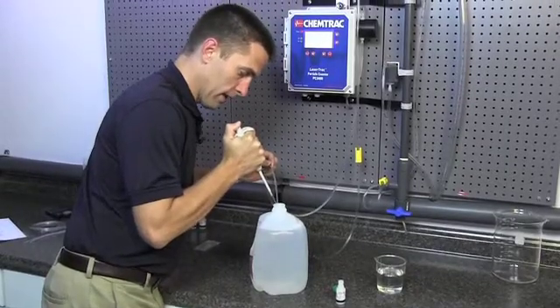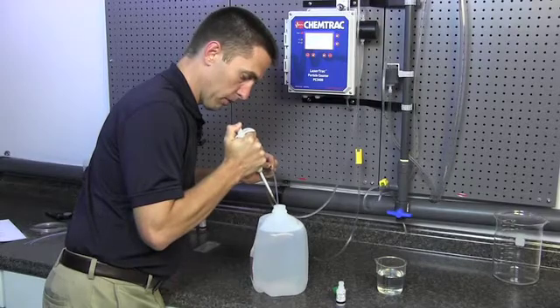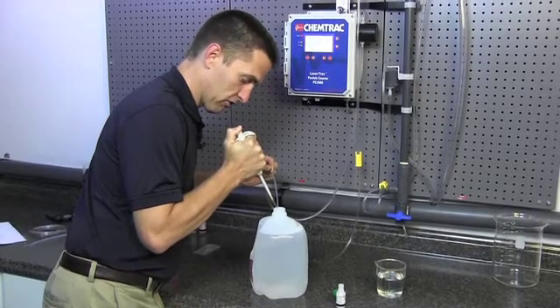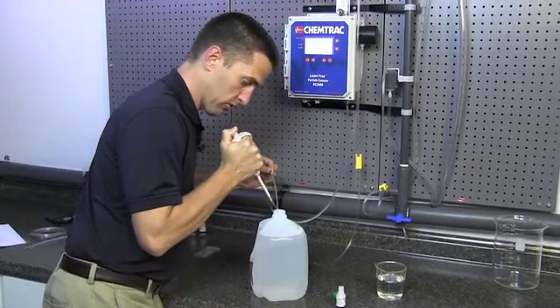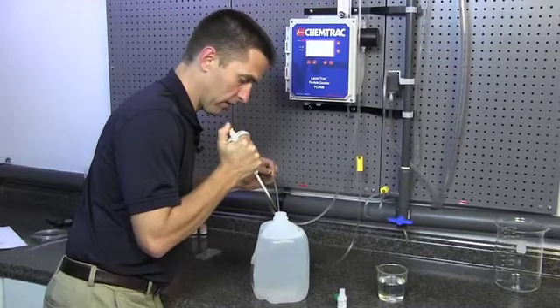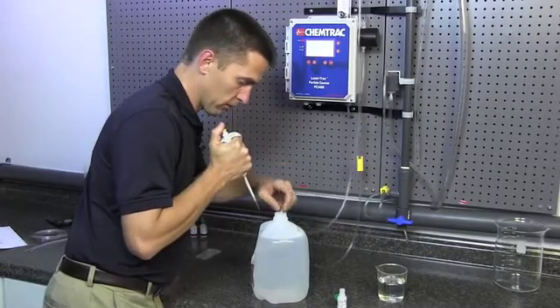I just depress the plunger all the way down to the second stop and let those little bubbles that formed on the end of the pipette attach themselves to the tubing. So now all of my spheres are mostly attached to the end of that tubing there. And we'll just insert that into the jug.